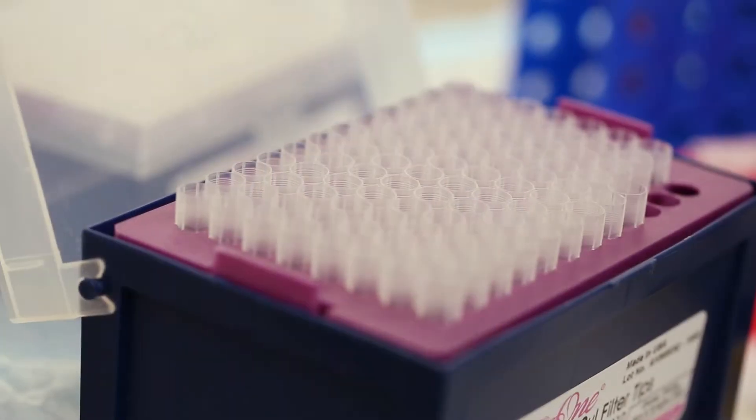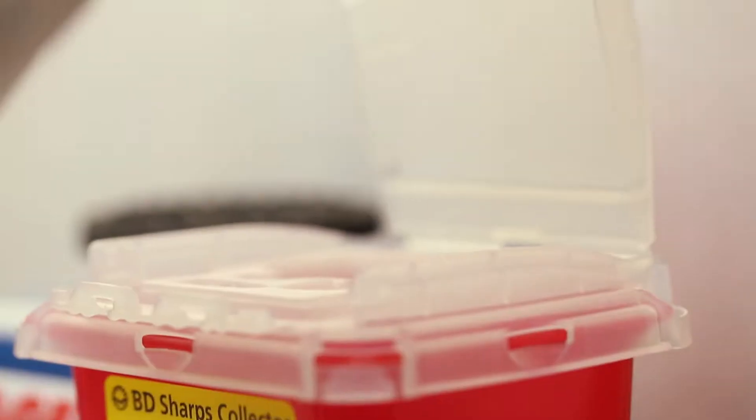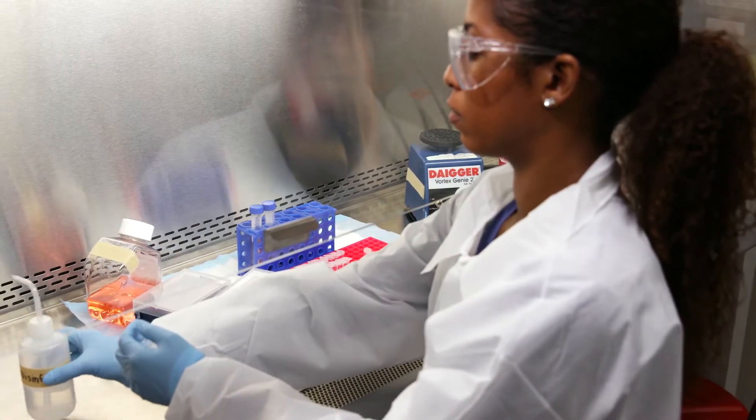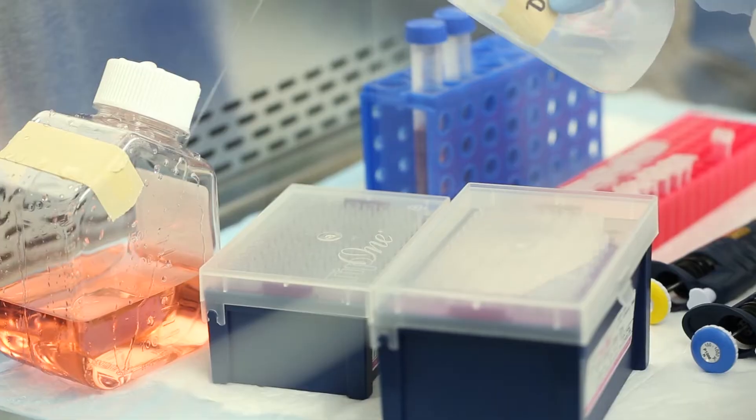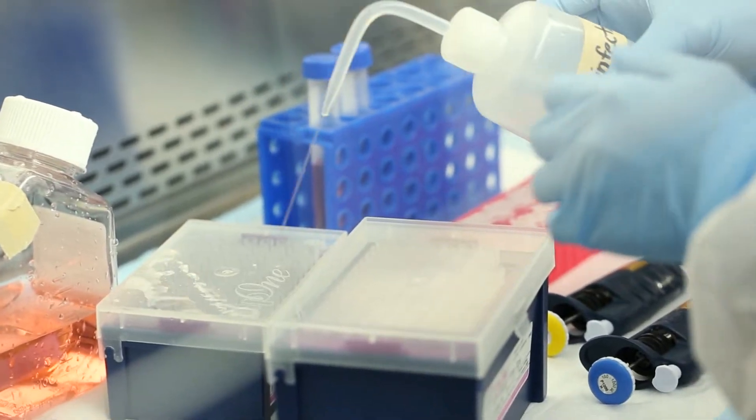The first thing that needs to be done is close all the containers. Next, using the same disinfectant used to clean the cabinet before work started, generously apply disinfectant to the materials in the cabinet.